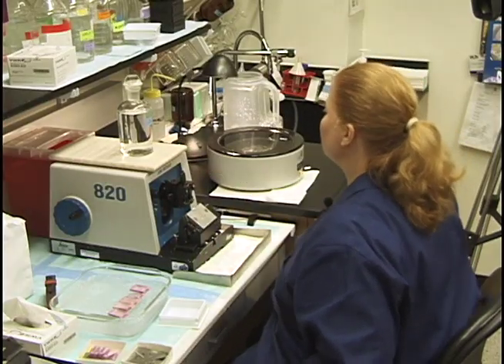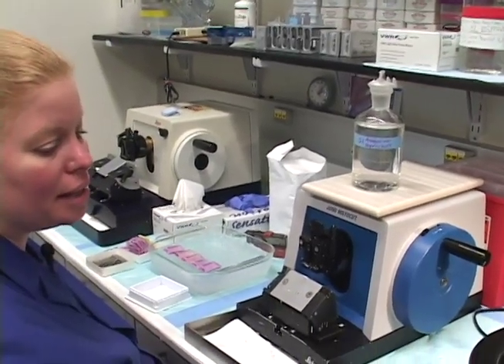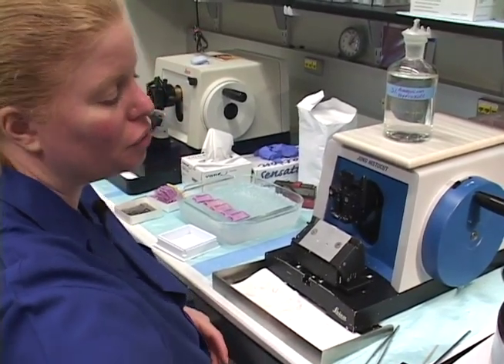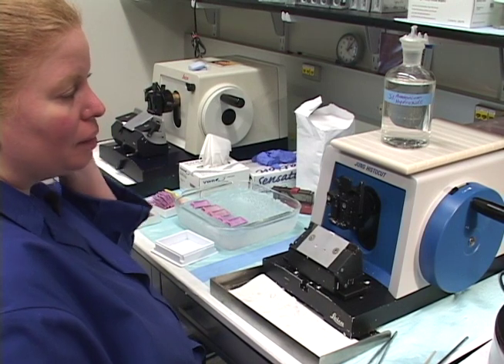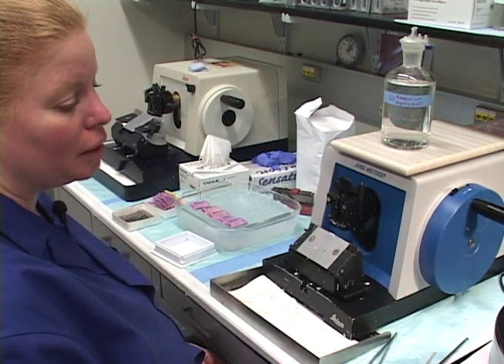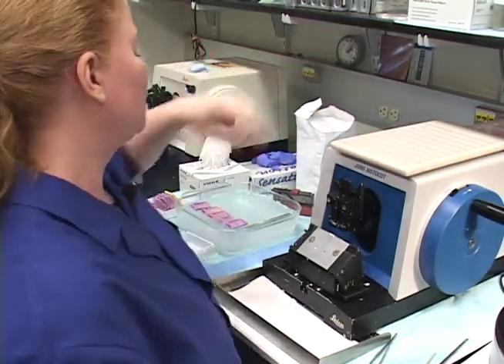That's a nice trick. With ammonium hydroxide you should still be able to get very good stains, and you can still do immunohistochemistry on your tissue. The only problem would be if you over-soaked it — if you put it in and forgot about it. So don't walk away from it when you're using that chemical.